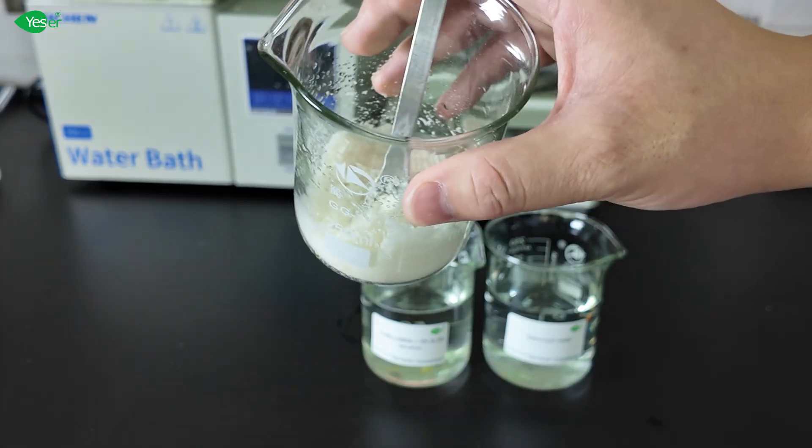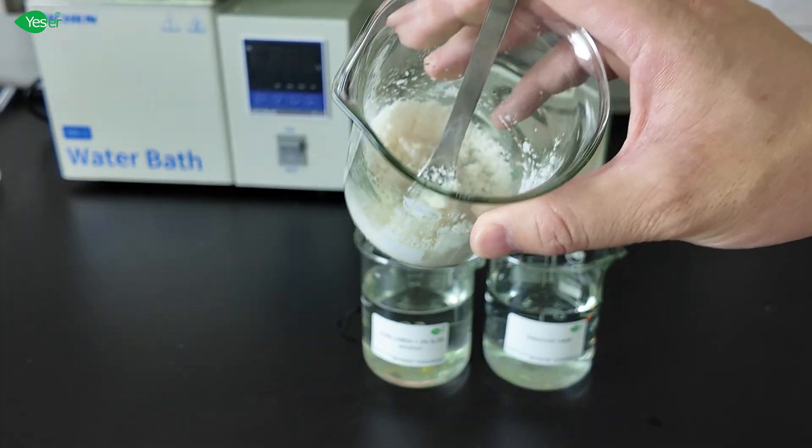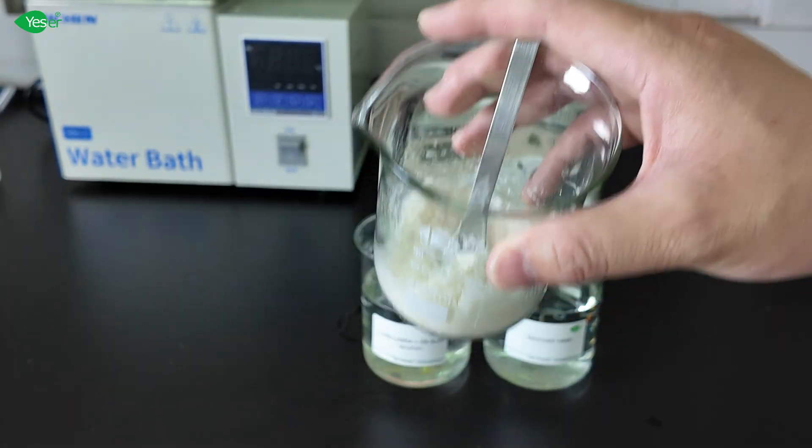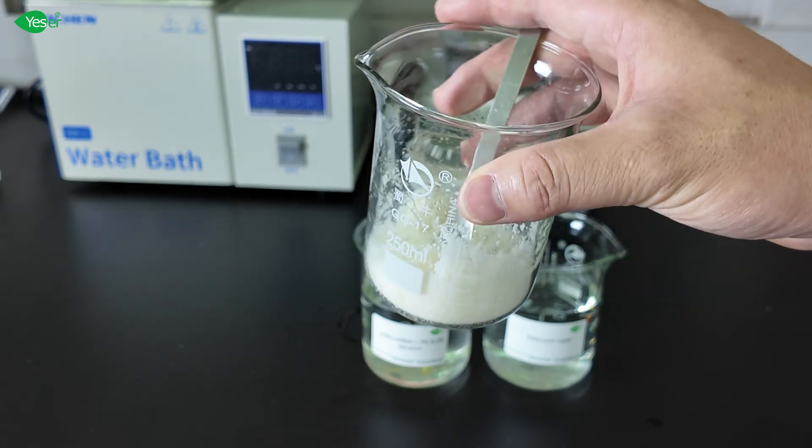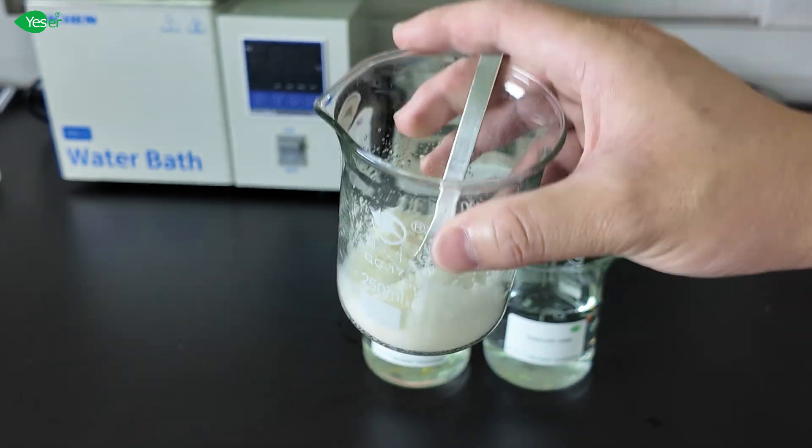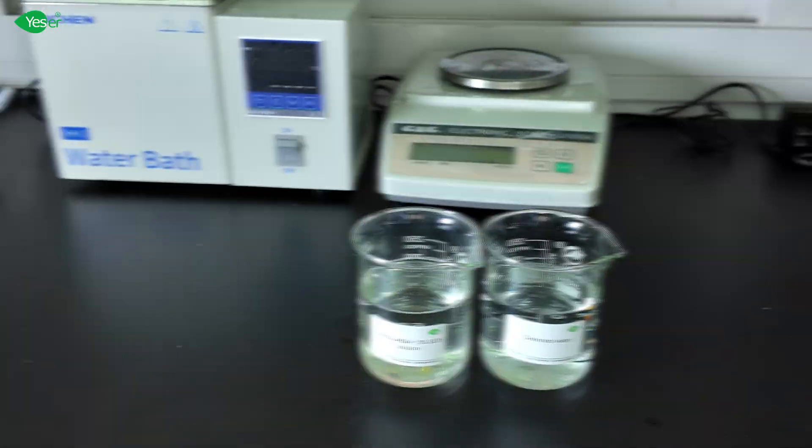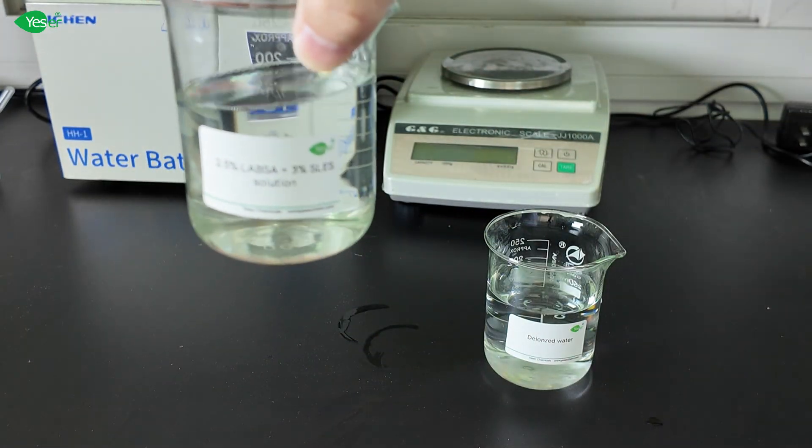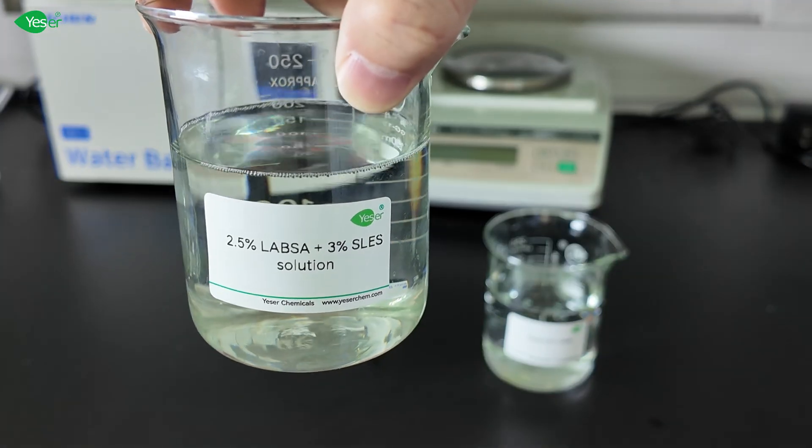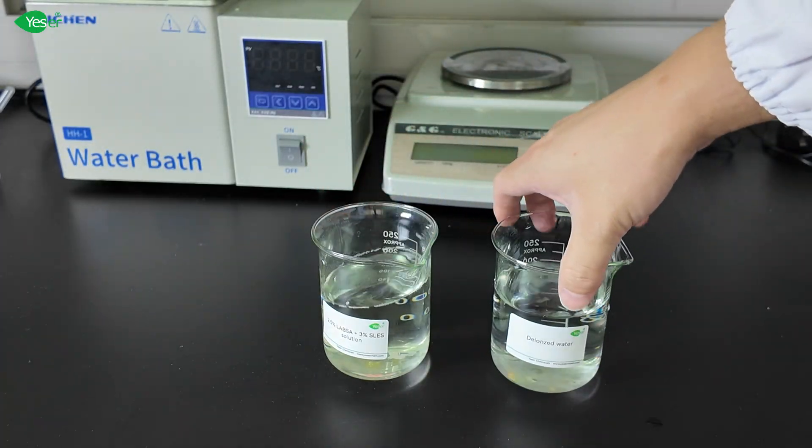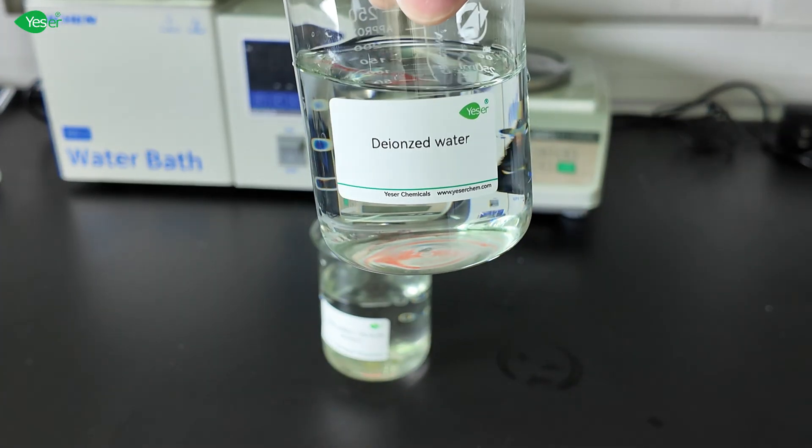Now we have let this pre-blended HPMC with salt sit for 5 minutes, and now let's test how it works. Next, I have prepared this surfactant solution with LABSA and SLES, and this pure deionized water.